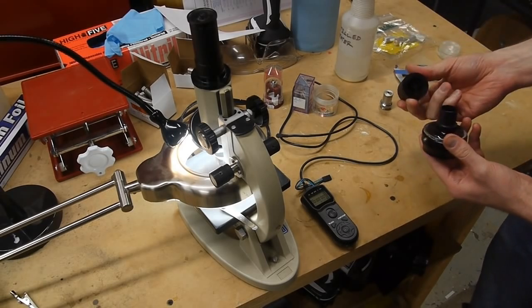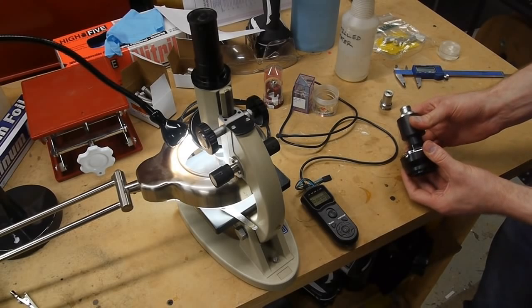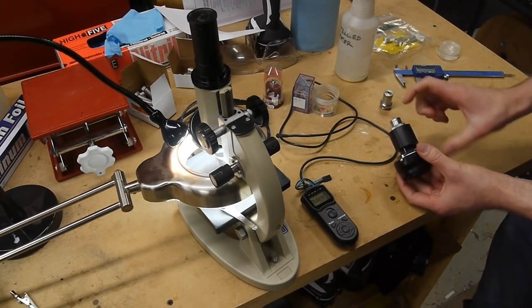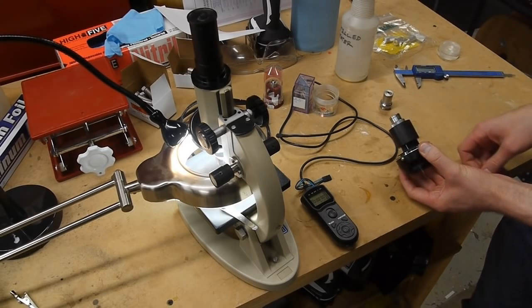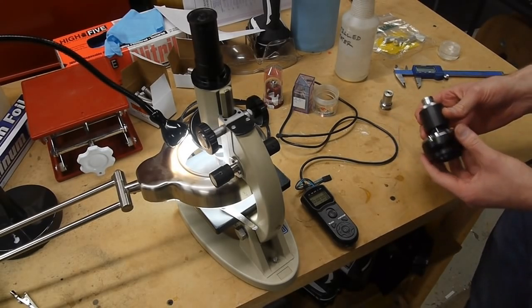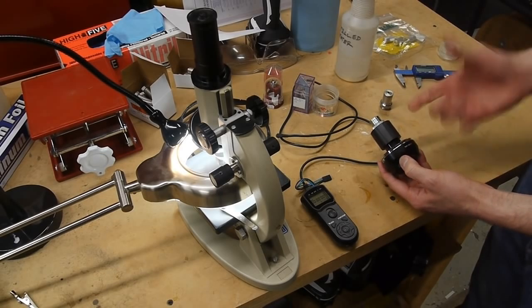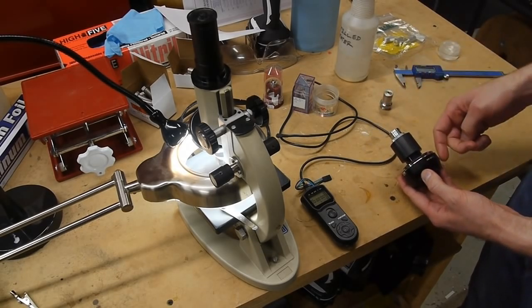So this piece just comes off like that. And you can actually slide this around. It's meant to be sort of a friction fit here, so you can control the distance from the lens to the camera. One thing that's cool to remember is that the amount of magnification you get is dependent only on the distance, or the ratio of distances from the lens to the image plane and the lens to the object.